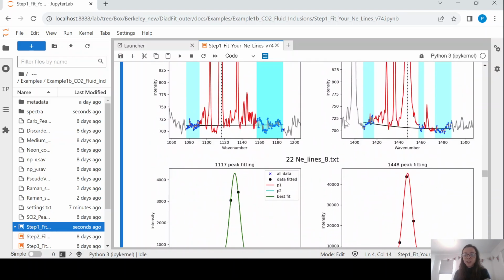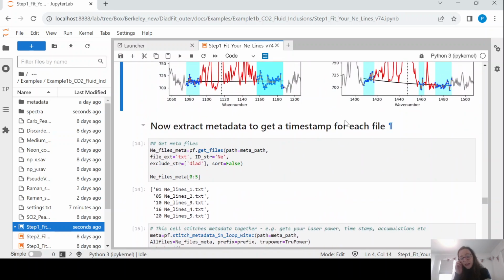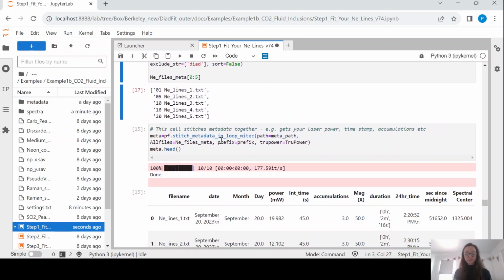Okay. So I've already fitted the peaks. This is also meant to take a really long time. To make a correction model of how my instrument is drifting with time through a day, I not only need the measured distance between the neon peaks, I also need the time at which that was done. So the WITEC metadata files contain timestamps, so we're going to extract that. The first thing we're going to do is identify all of the metadata files. So we're looking in that folder, meta path, we find above, and we're looking for any file which has a string containing neon, like above.